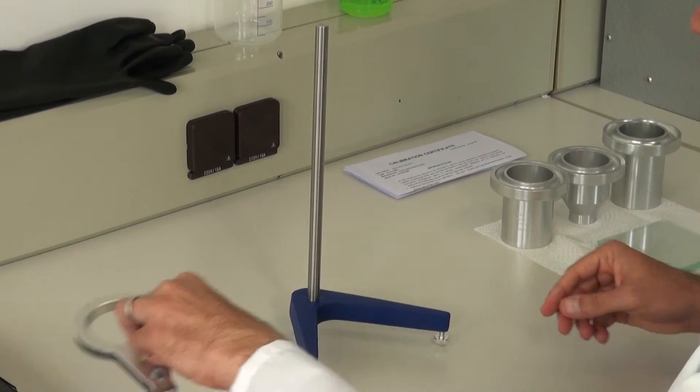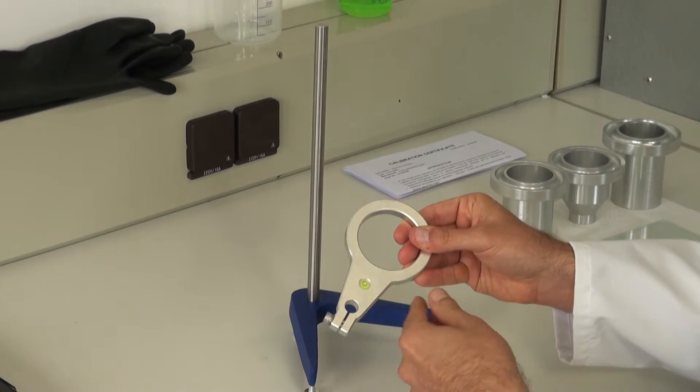Subsequently, the cup holder can be mounted. The cup holder has a level to align the cup holder.